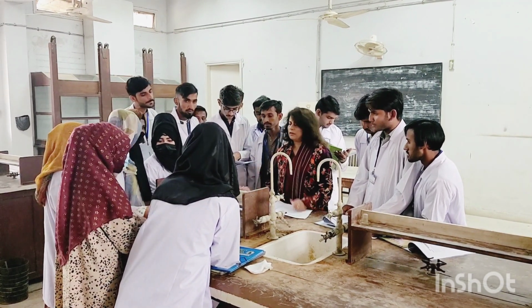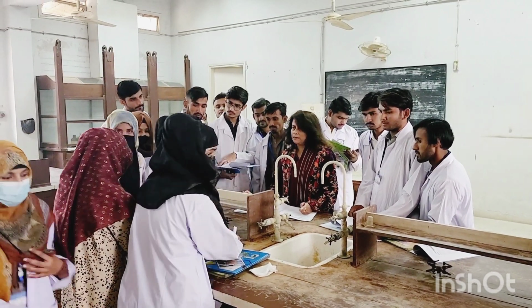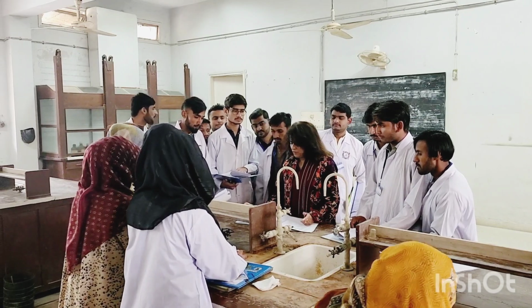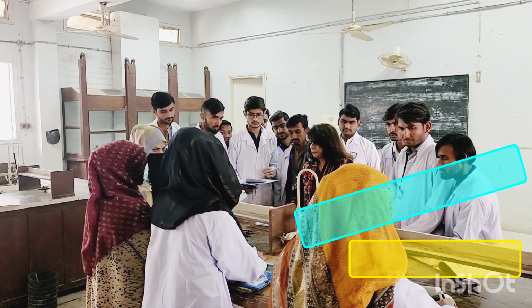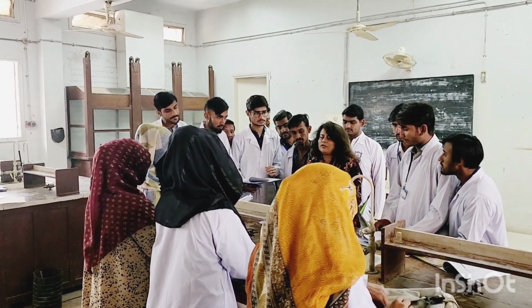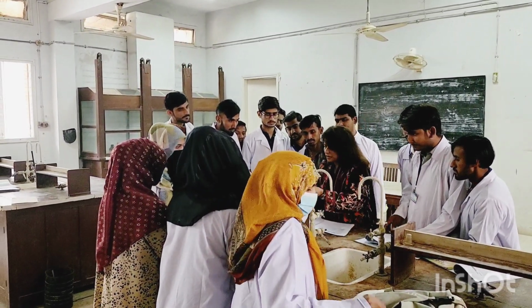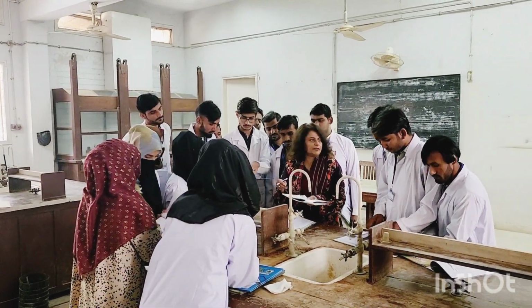Give me a scale. Who has a scale? Anyone has a scale? Keep things straight. You should have everything within your reach, your stationery. That's good. So now we will jump to page number 17.